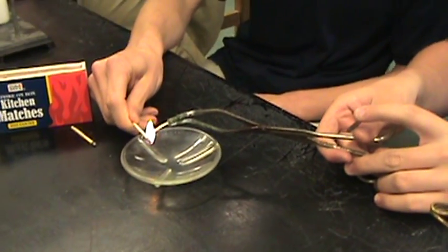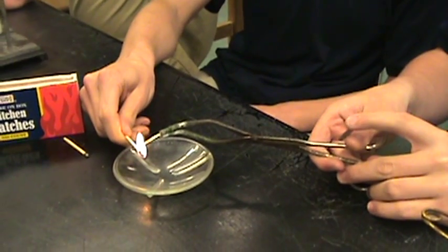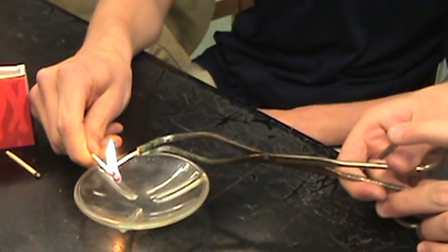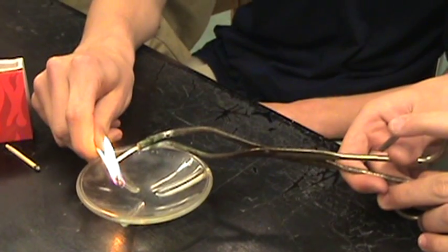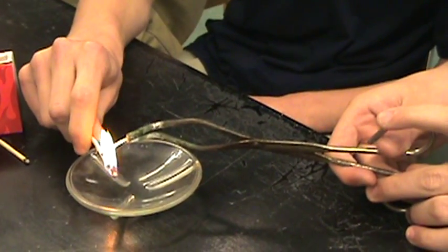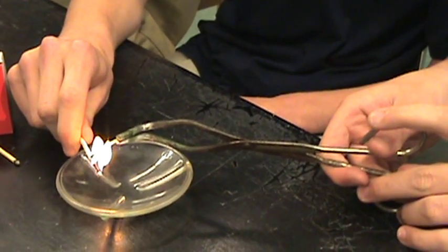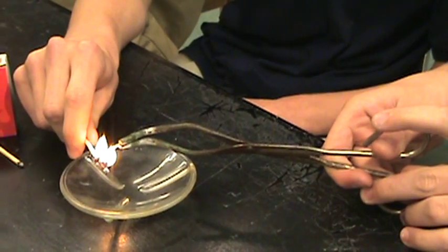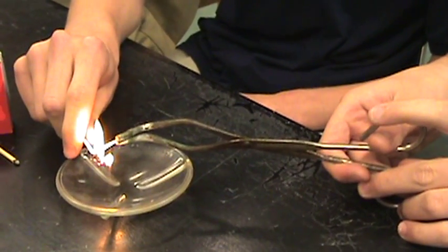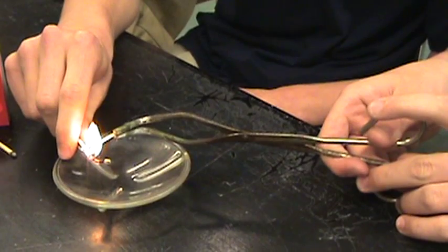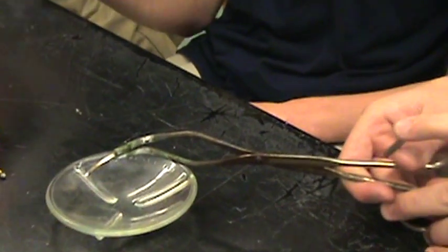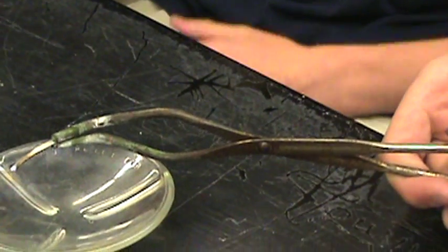So there we go, that's a magnesium metal strip and it takes quite a while to ignite. Very nasty. You wait, make sure you don't have your fingers anywhere near it. Yeah, there you go, try it again.